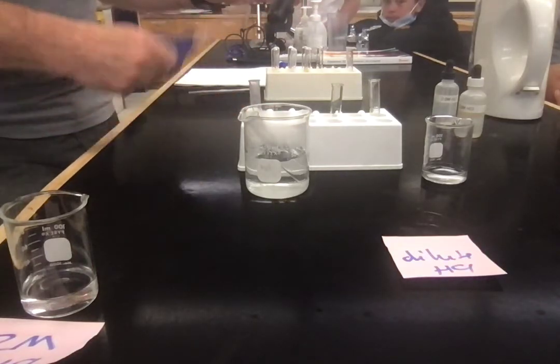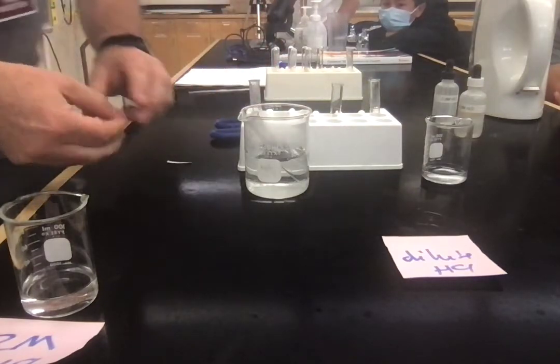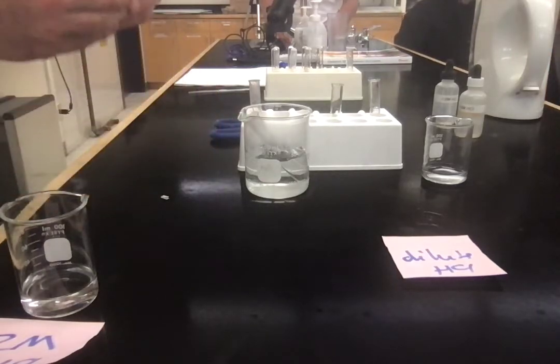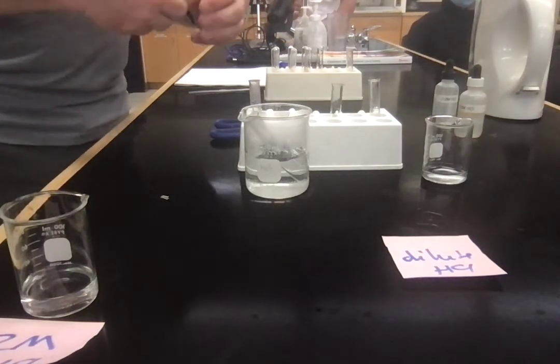Looks like I can just chop this one straight in half. Super accurate on this one. And fold this one, fold it, squish it, fold it, squish it.